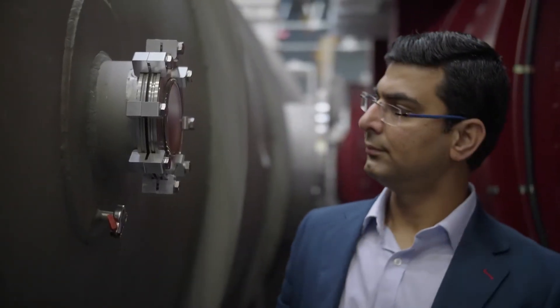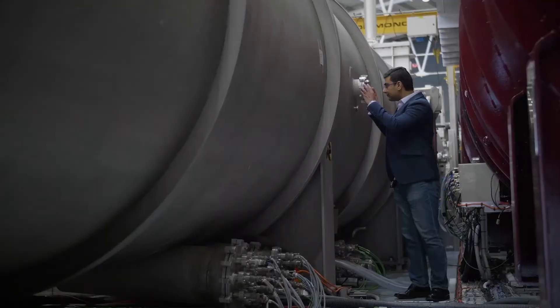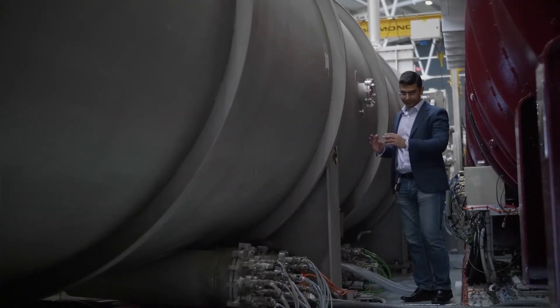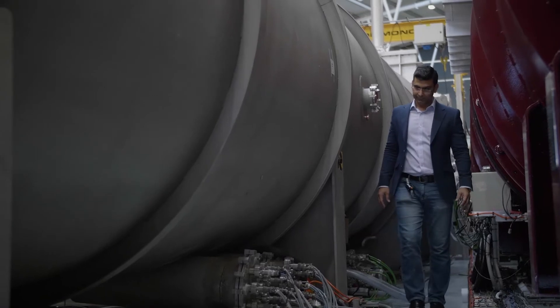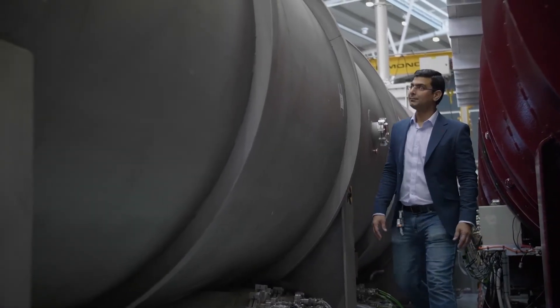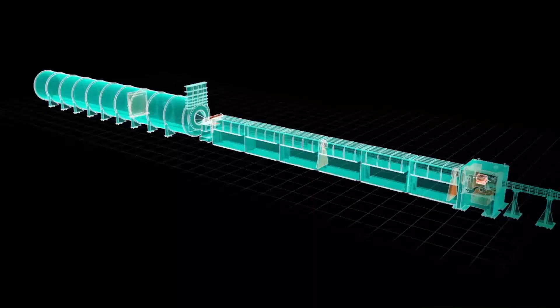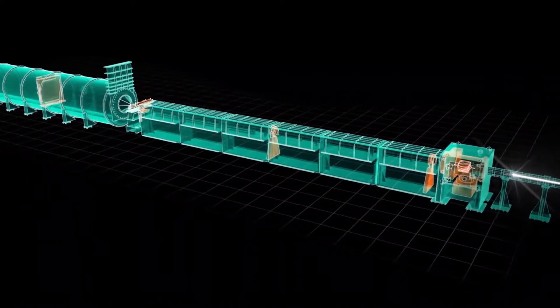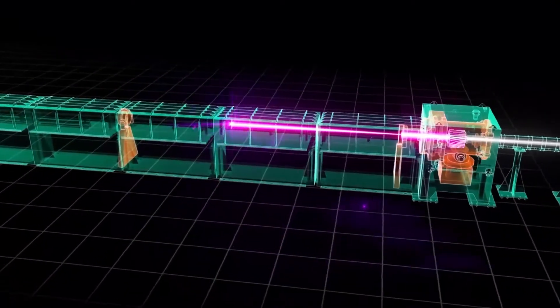It is like a very powerful microscope, which unlike using light, uses neutrons as radiation. Neutrons are produced in a nuclear reactor just there, and they are transported to this instrument via guides. Guides are like a highway for neutrons.